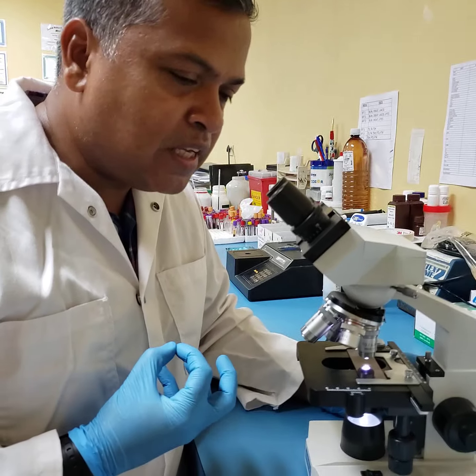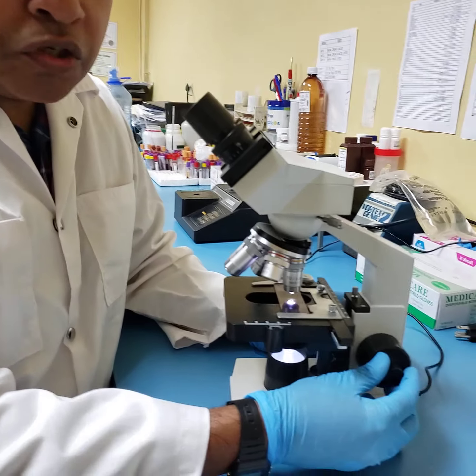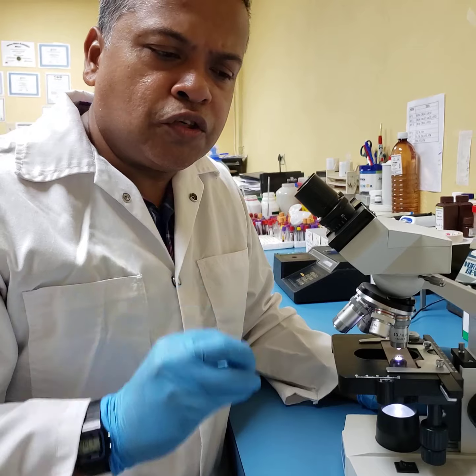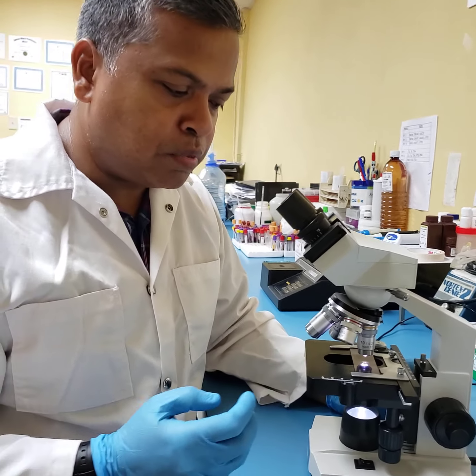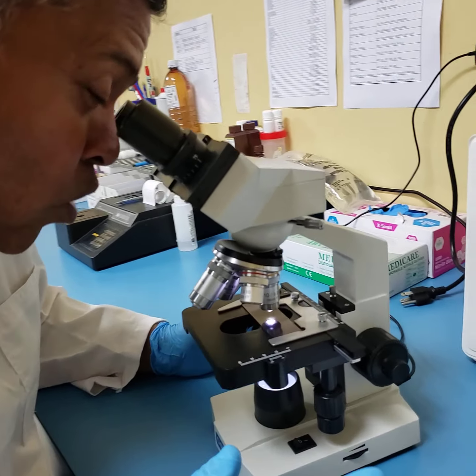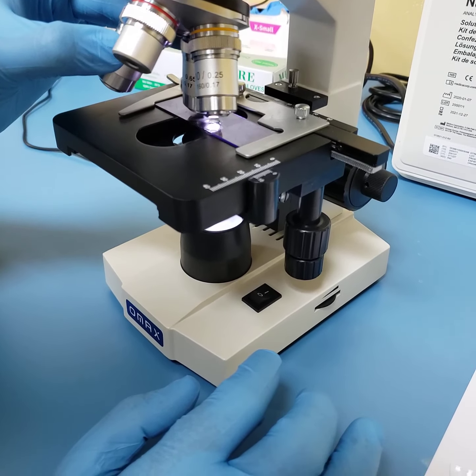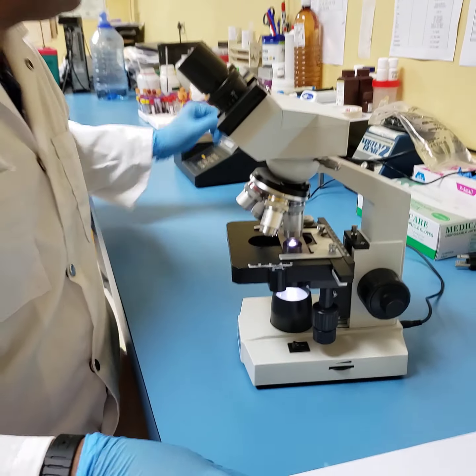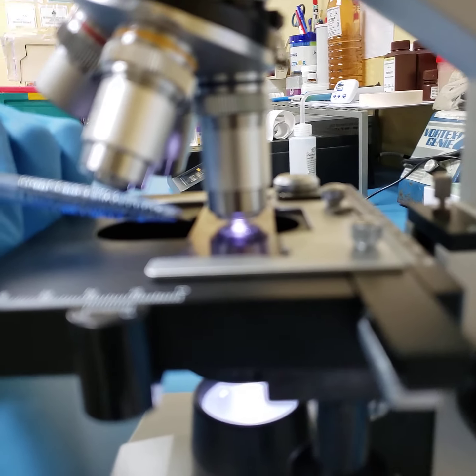So obviously what I'm seeing is a bigger magnification, a bigger image, but all I did was adjust my fine focus. Very important. Just to recap here, the coarse adjustment knob is only used in the initial adjustment of your stage in microscopy. But now I'm not happy. I want to magnify this image a little bit more. So what I'm going to do now is engage my nose piece and go from 10 to 40. You will notice here that the times 40 lens is very close to the slide.